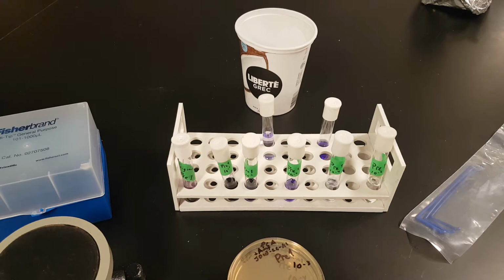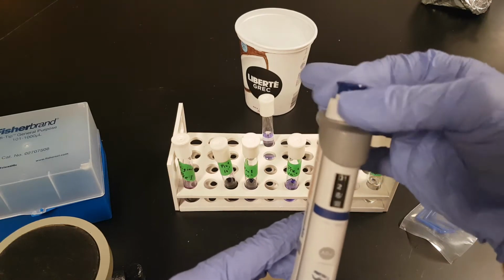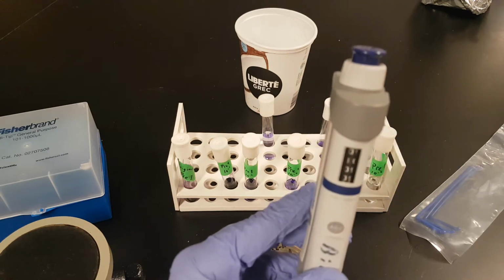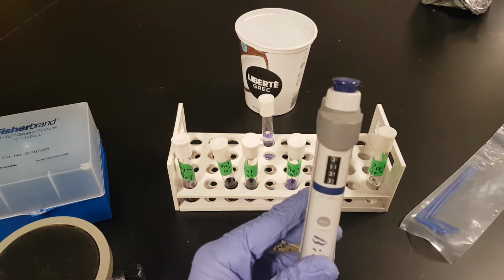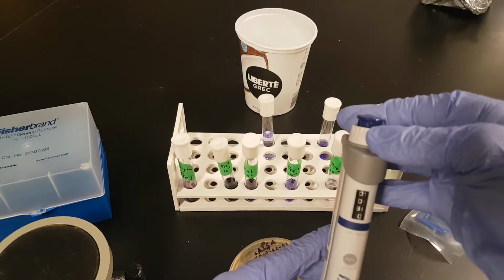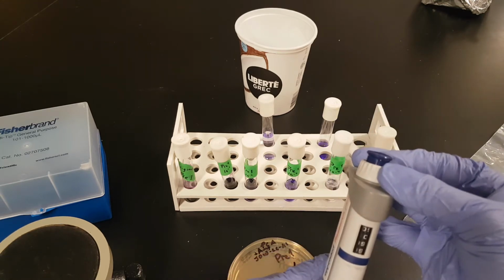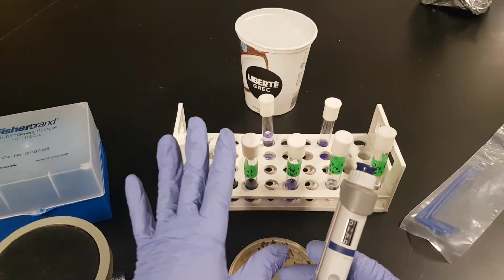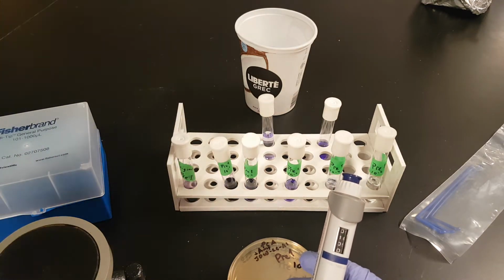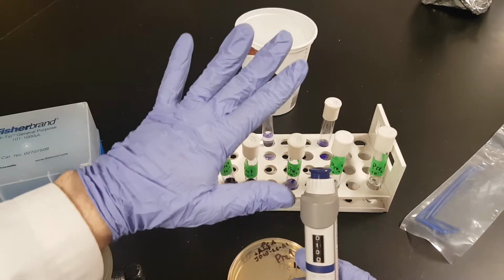Okay, so the reason we're doing that is pretty simple. We are going to be putting on these plates 1/10 of a milliliter, or 100 microliters, which is as low as this thing measures accurately. You can take it down further, but it doesn't measure accurately. It's not built for that. We are at 100 microliters here. Okay, so here's the thing. All of these numbers that we have here, we are ultimately looking for a microbial load of X number of CFUs, colony-forming units per milliliter, right?